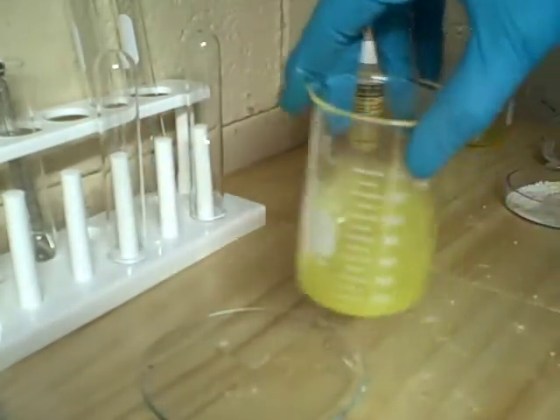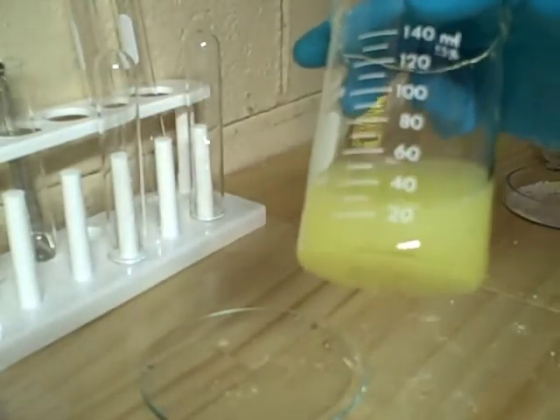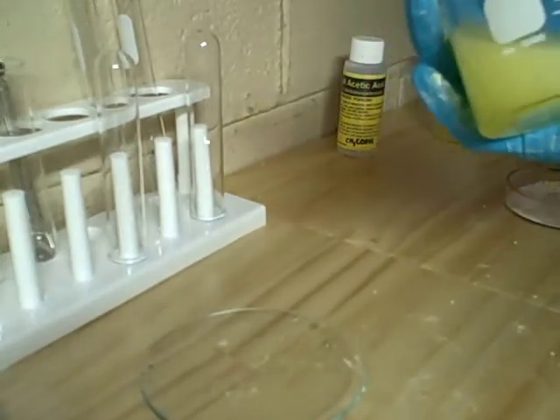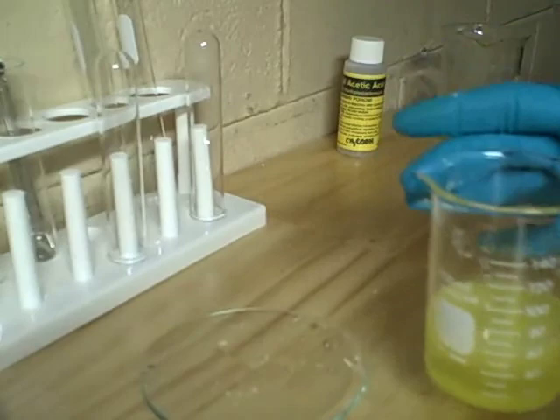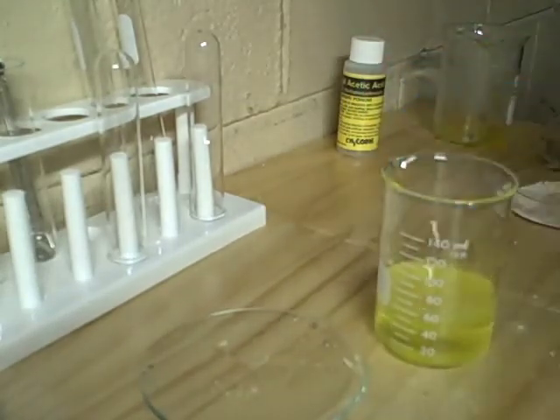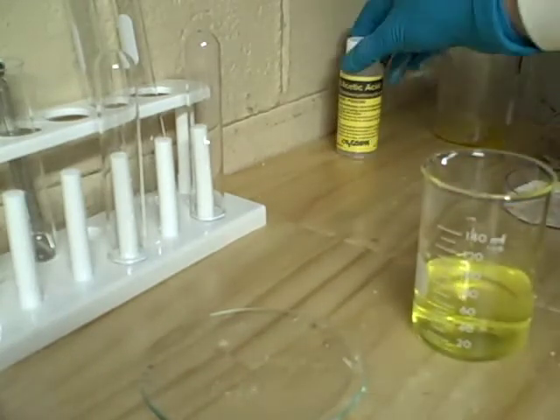So that's about good — now we'll have the solution. As you can see, it has the impurities from when we had our vinegar. This solution can vary in color as well. We're going to want to distill this to get the final product.